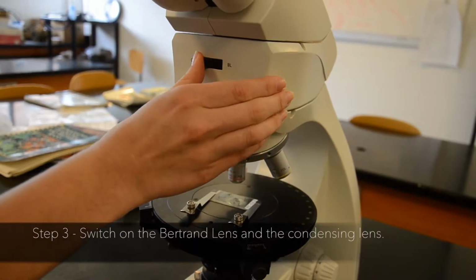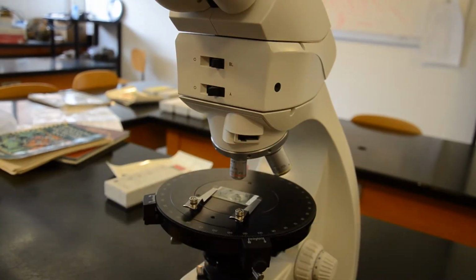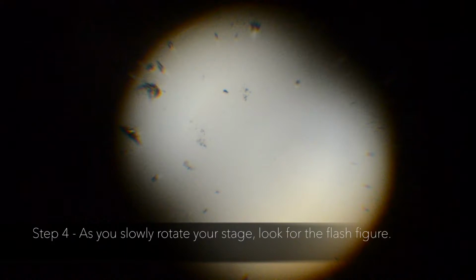Step 3. Switch on the Bertrand lens and the condensing lens. On this microscope model, the switch labeled BL above the cross-polarizer switch inserts both. Step 4. As you slowly rotate your stage, look for the flash figure. Your figure should become extinct from opposite corners and then illuminate itself in the other corners. Here, I am only rotating the stage by very little, only a couple of degrees.